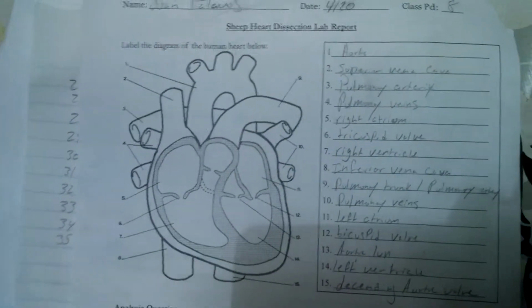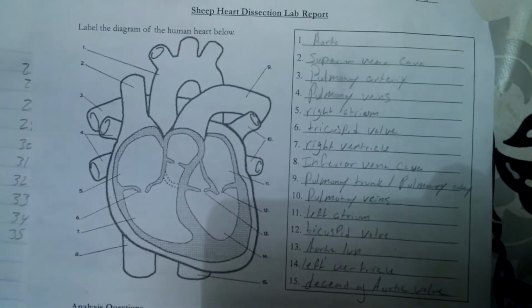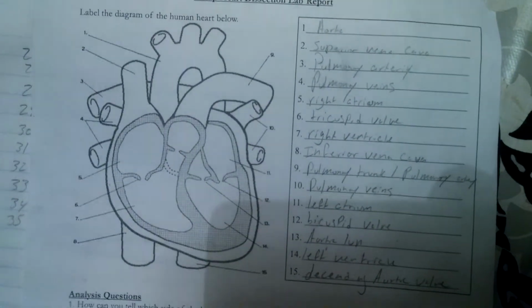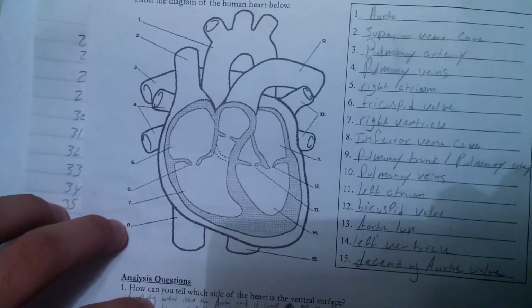They need to push the blood with a lot of force, because it's a lot of blood and it needs to flow to your entire body. So they need to be thicker, filled with more muscle to do such a thing.